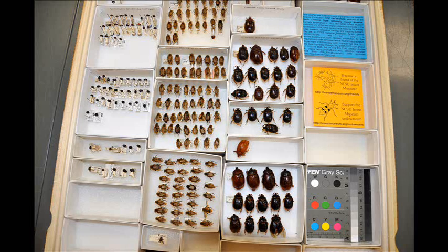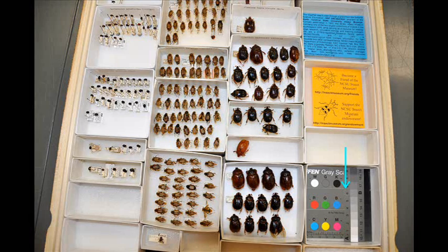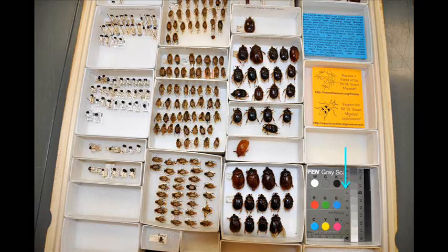Finally, some additional notes. For our project's research purposes, we include a few additional steps. First, while placing the filler material in the white space of the drawers, as discussed earlier, we also add color standards to the bottom right corner. This allows for future color and exposure correction.